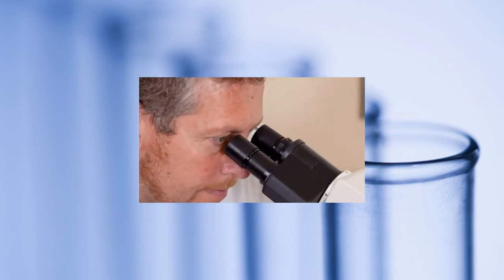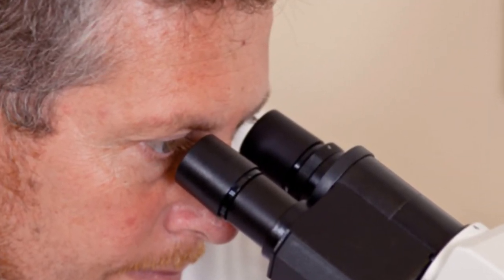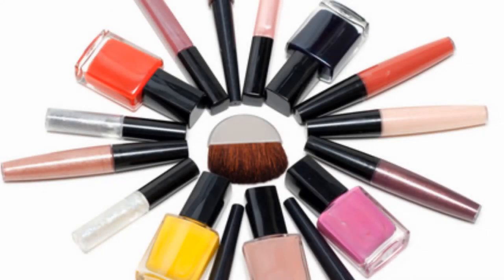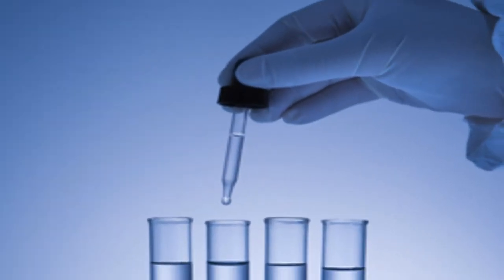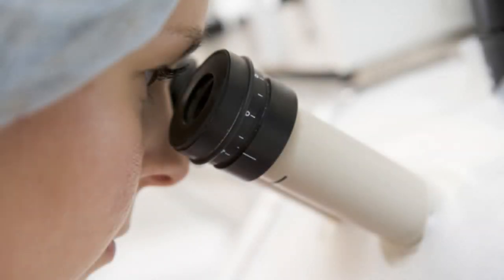Samples of the soap were sent to EMSL Analytical. Using TLC analysis, the spots were quickly identified by EMSL scientists as D&C red and yellow pigments. These colorants are commonly used in cosmetics. Once the soap manufacturer received news of the findings, they were able to identify and isolate the source of the contamination in the production facility.